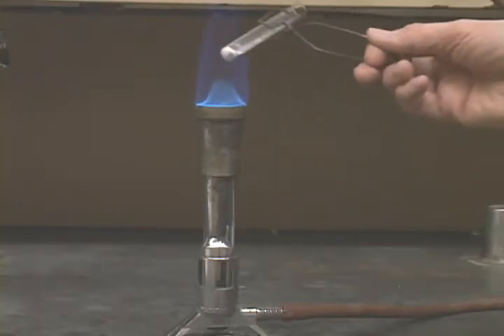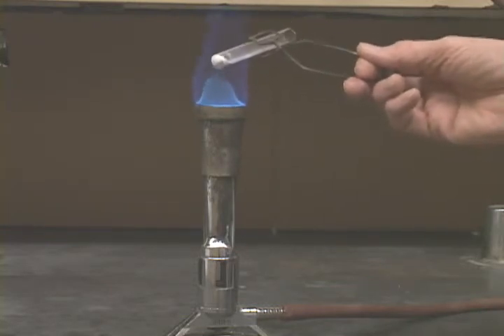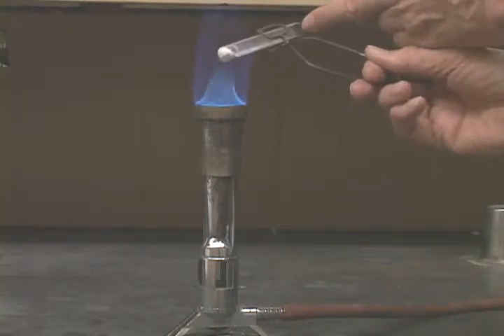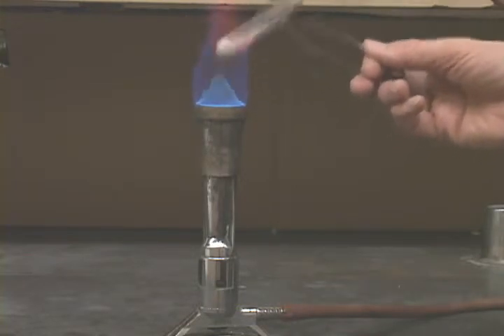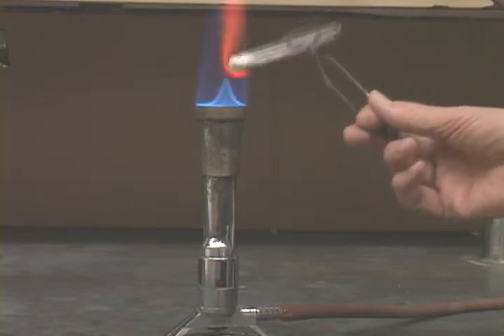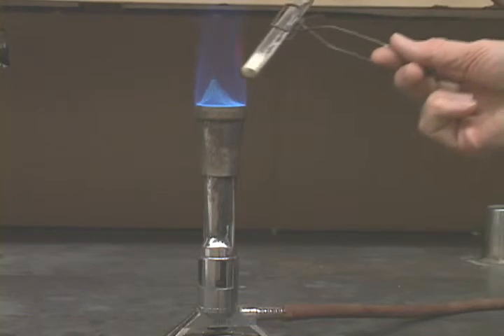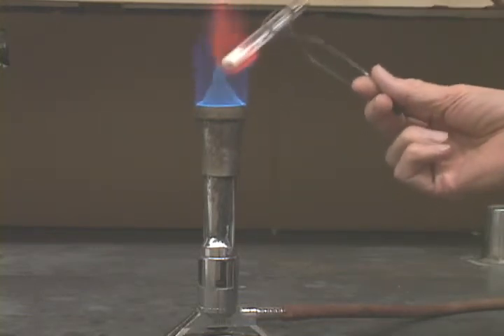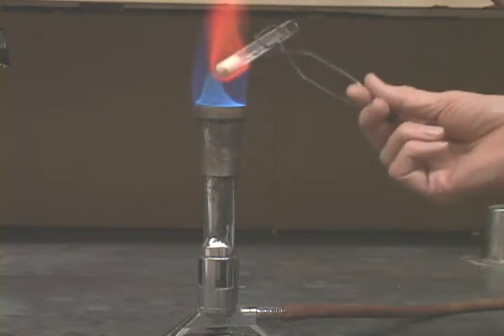Heating the first tube. Now remember, when you put this in the flame, make sure that you do not put the top of the tube in the flame, so that any water which wants to come off will condense in the top. And as you can see, there is essentially little or no water condensing. And then make sure also you do not point the top of this tube at anybody, because you don't want anything to spurt out. But heating this produces essentially no water.